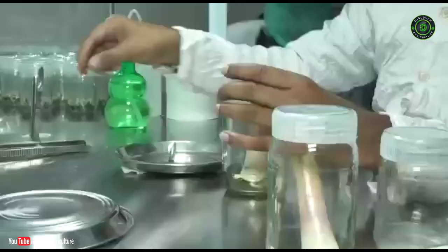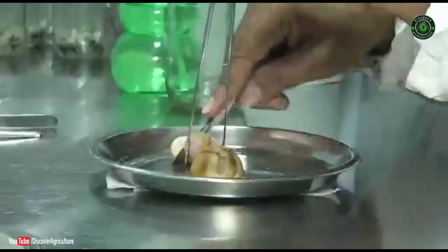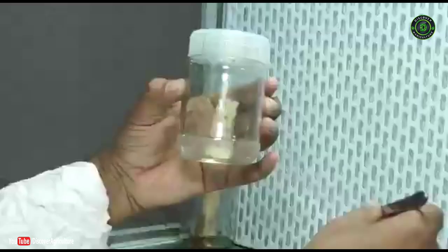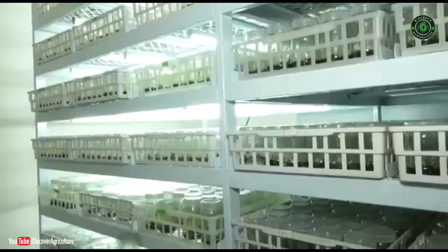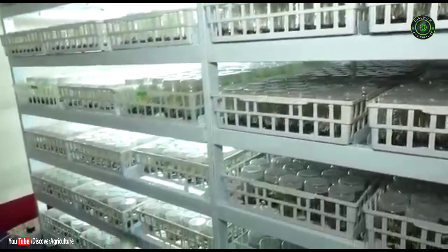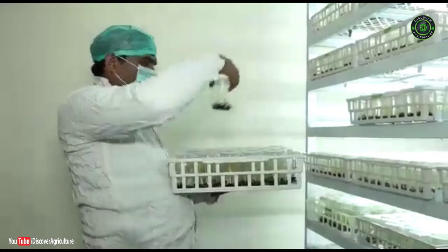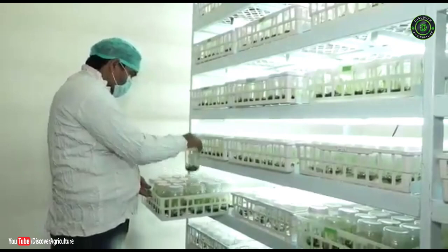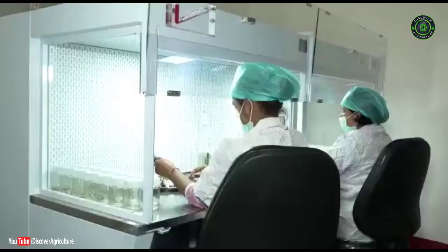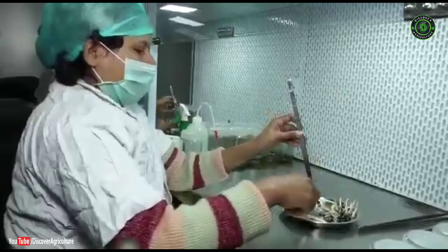The explants are trimmed using a surgical blade to a final size of about 3–4 cm length and 1–2 cm diameter. The explants are inoculated under sterile conditions in 30 ml of initiation medium in a 250 ml glass jar container. The optimal incubation temperature is 24 to 26°C. Light intensity is maintained at 1500 to 3000 lux. Initially, cultures are maintained at 16 hours light and 8 hours dark cycle, then shifted to 14 hours light and 10 hours dark cycle.